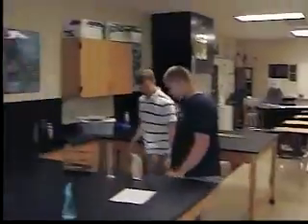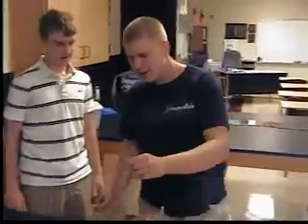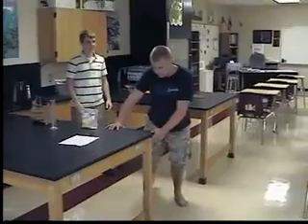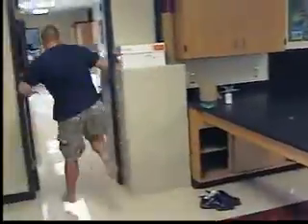Shouldn't you be wearing shoes? No, I've done this millions of times. Why would I need to be wearing shoes? I wonder what time it is. I don't even have a watch. Oh! My foot! Oh my god, my foot! Ah, my foot!